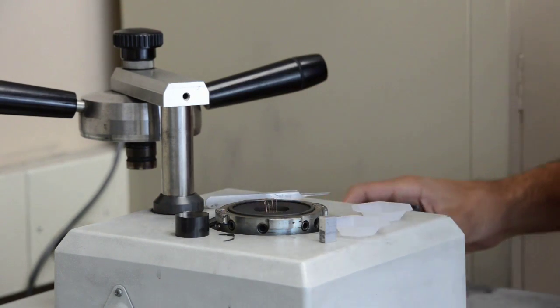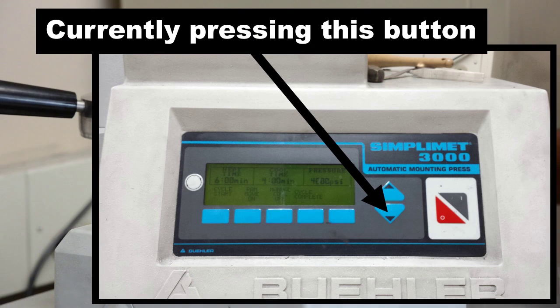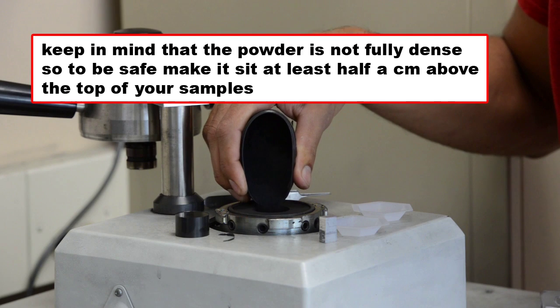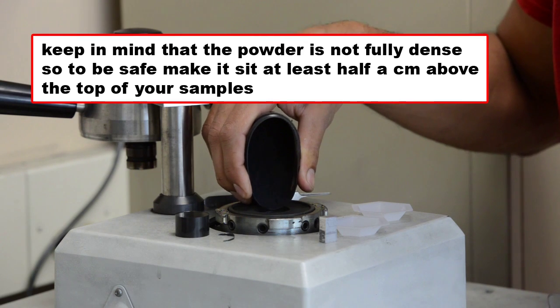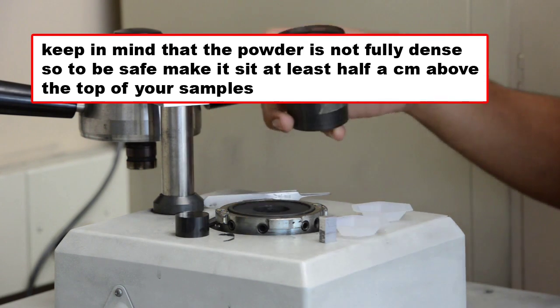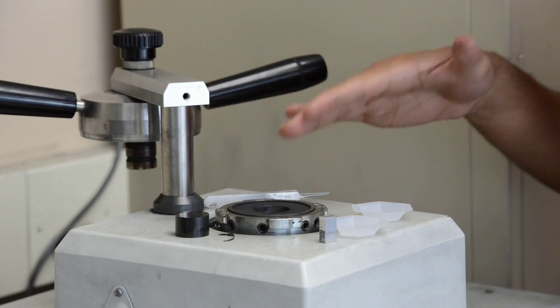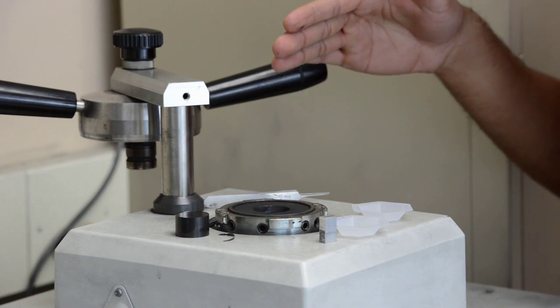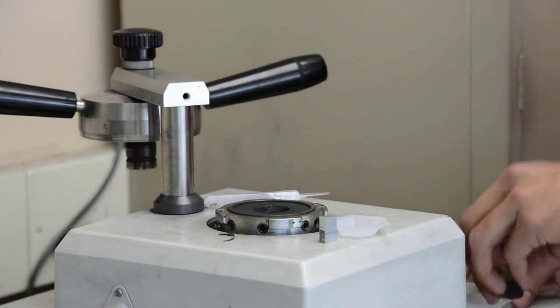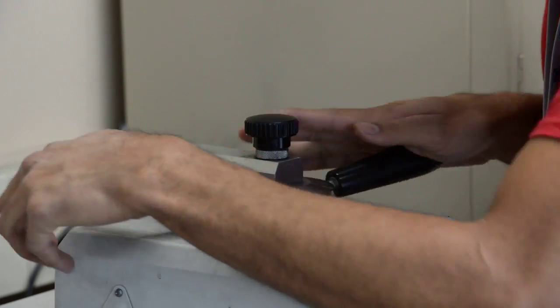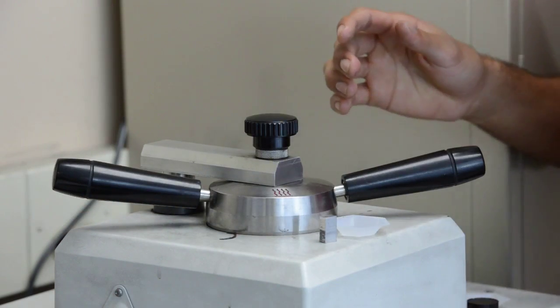And the same thing. Just lower it. Pour more conductament. Make sure you pour enough to not have your samples get crushed. Lower it all the way. Well, not necessarily all the way, but enough so that this can come down. Twist and start cycle again.